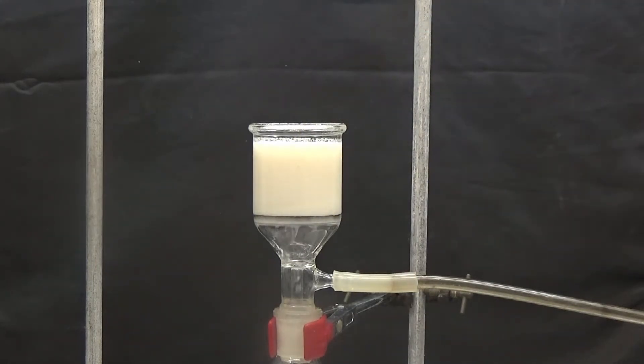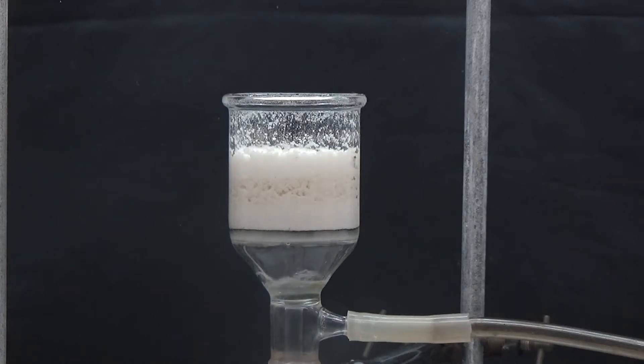We separated the solid by vacuum suction and washed it twice with 20 milliliters of diethyl ether.